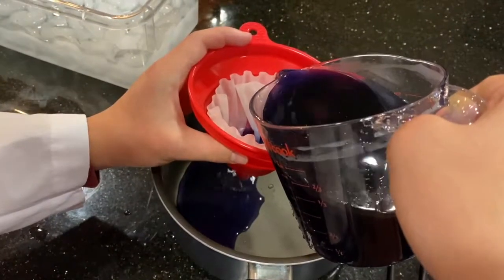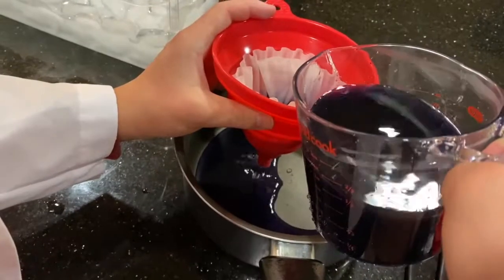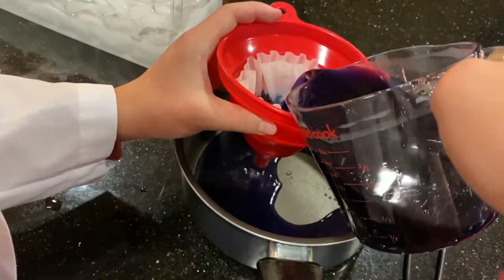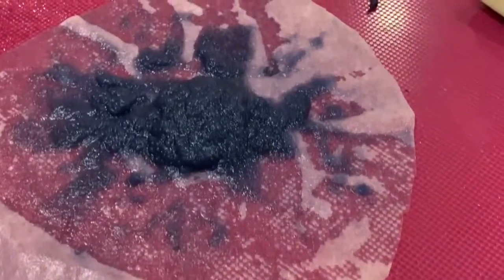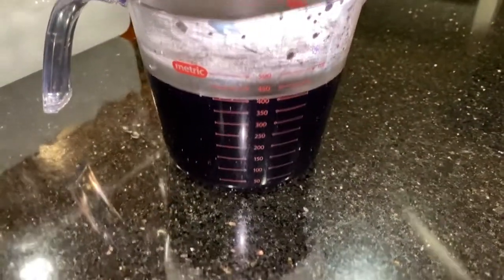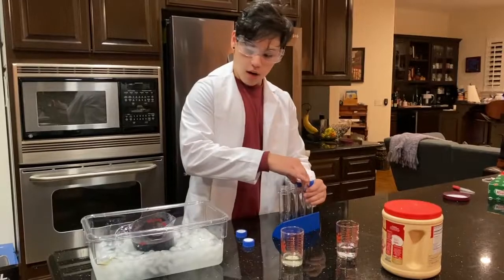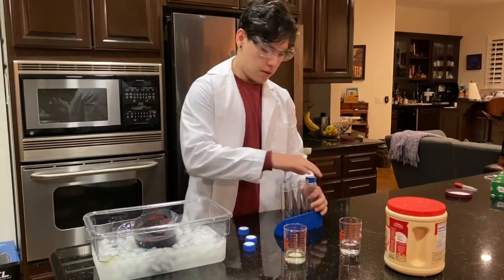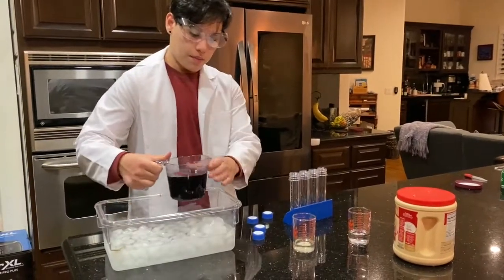After cooling, we made sure that all the non-polar or relatively non-polar compounds that came out during cooling had precipitated — and here they are on the filter paper, quite a lot of them. Unfortunately we don't have the tools to filter this any further, as all of the remaining compounds are incredibly polar, so we just have to work with what we have. After reheating the solution, we started with 500 ml and ended with about 400 ml. We're going to pour about 25 to 50 ml into each test tube with some leftover liquid — that's okay.